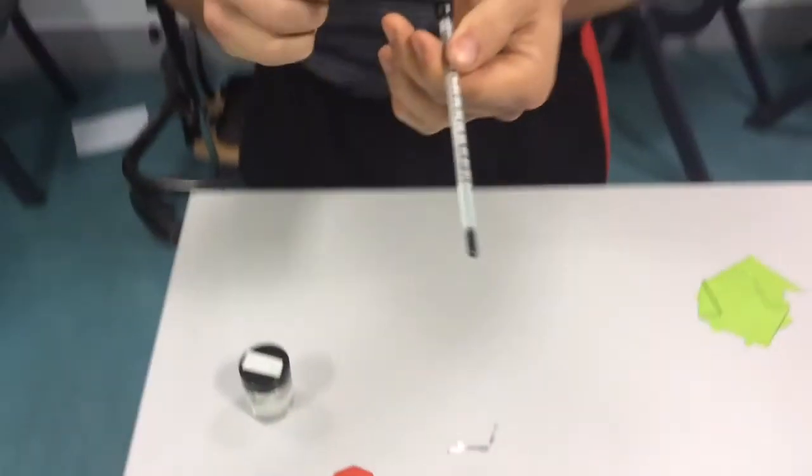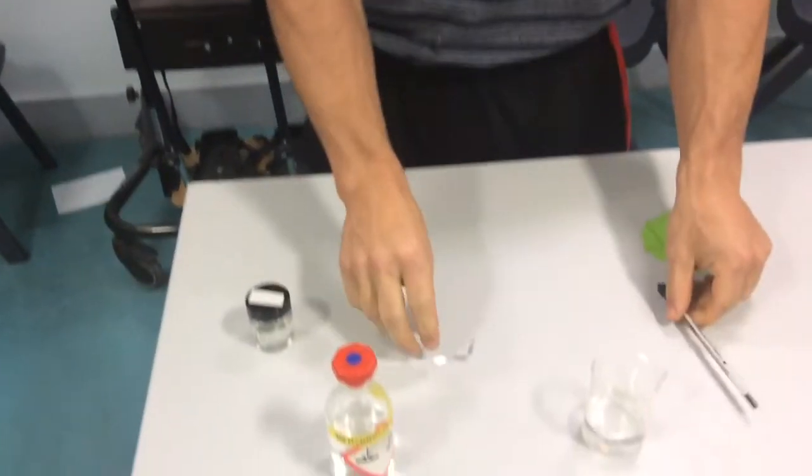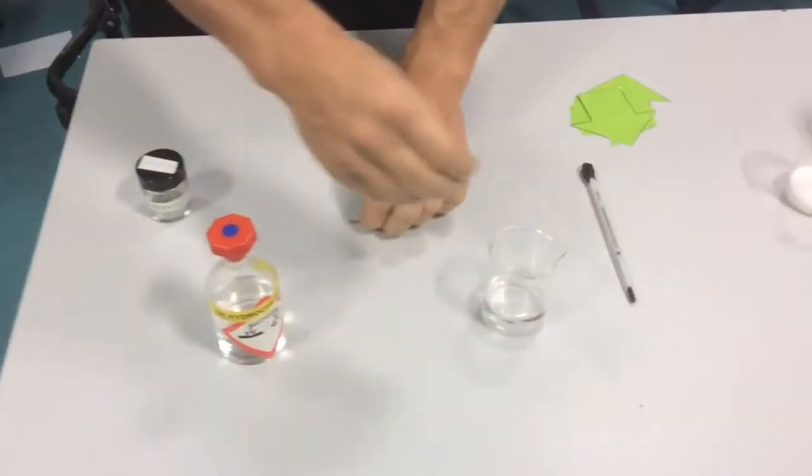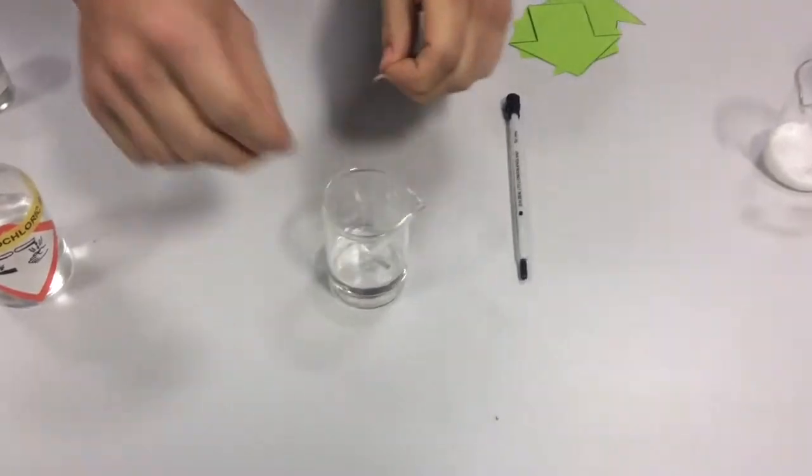Let's see what happens to the temperature on this thermometer when I add magnesium. So I'm going to pop some magnesium into the hydrochloric acid, and we see first of all, how do we know a reaction is taking place?